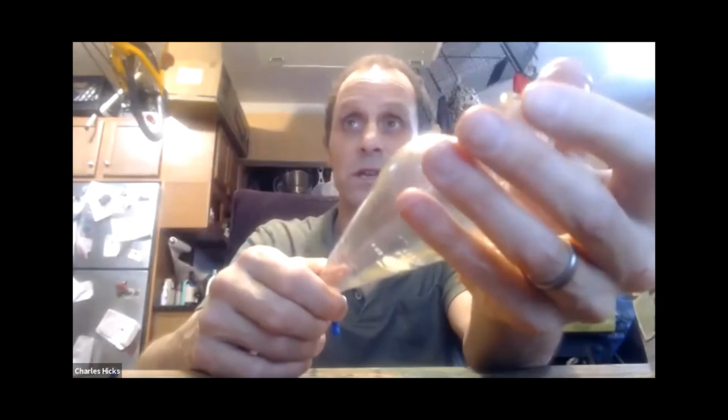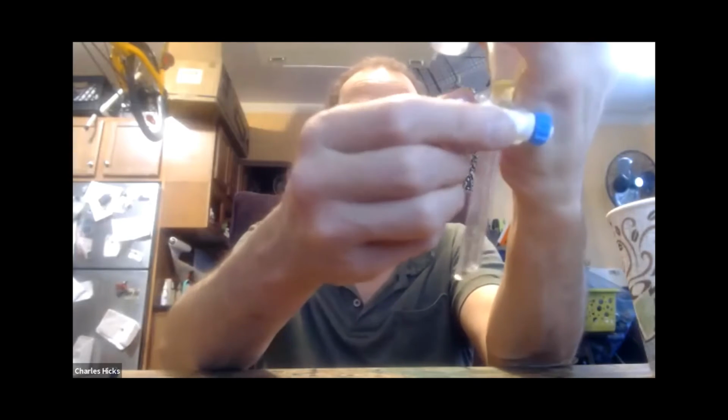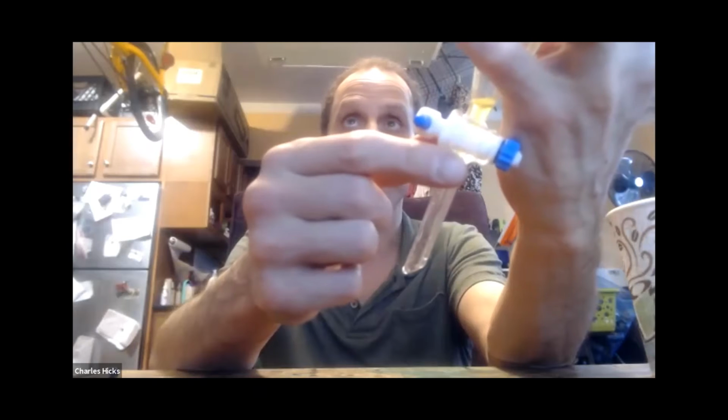Today we're going to be using a very specialized piece of glassware known as a separatory funnel. A separatory funnel has a design that makes it very useful when we want to mix together liquids that don't combine, like oil and water or organic solvents and water. We can shake them up and give them a chance to react or equilibrate together. And then because of the shape of it, we can drain off one of them from the other by opening up this valve here on the bottom.